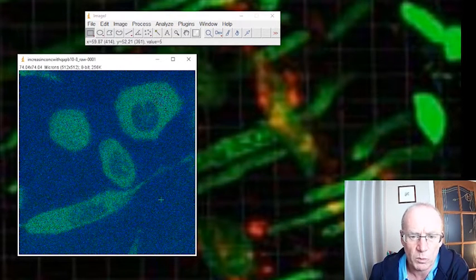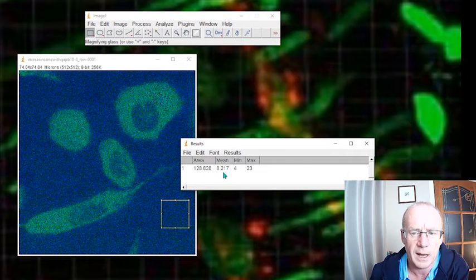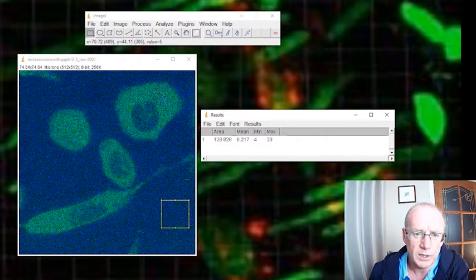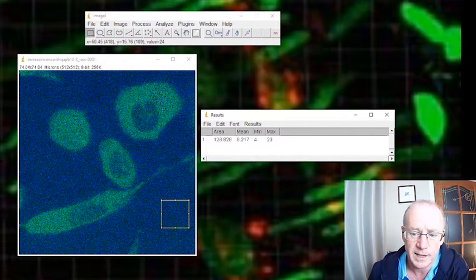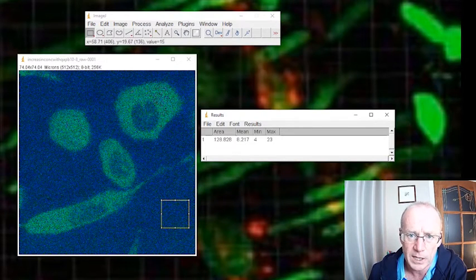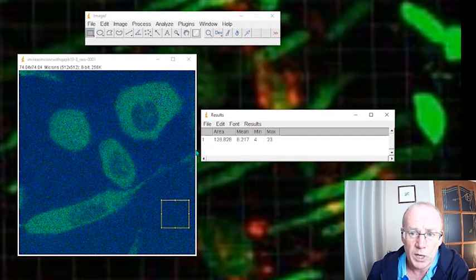The simplest way, or one way, would be to determine what the mean fluorescence is on the background. So I'll draw a little square, and quite simply just measure that. Find out what the average fluorescence is. Looks as if it's about 8.2. So really what I would want to do would be to subtract a value of 8.2 from the fluorescence on my cells, because whatever fluorescence I measure on these cells is 8.2 units higher because it includes the background. So I want to subtract 8.2 from my entire image here.